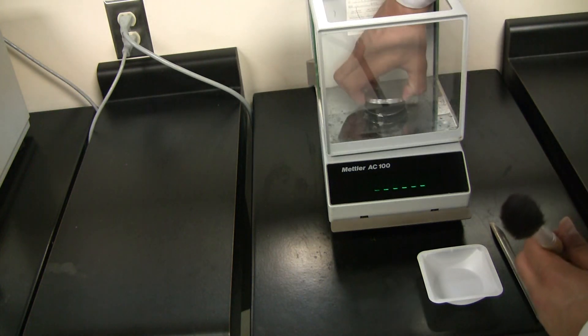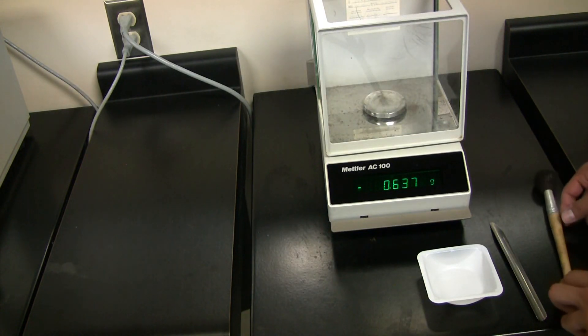Replace the plate, and you're ready to start weighing. Make sure to tare.